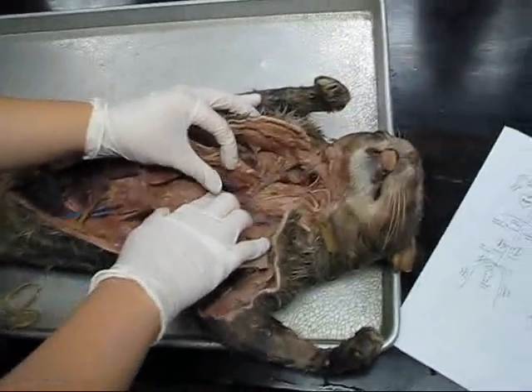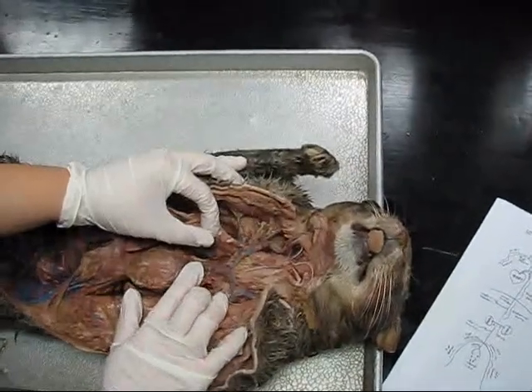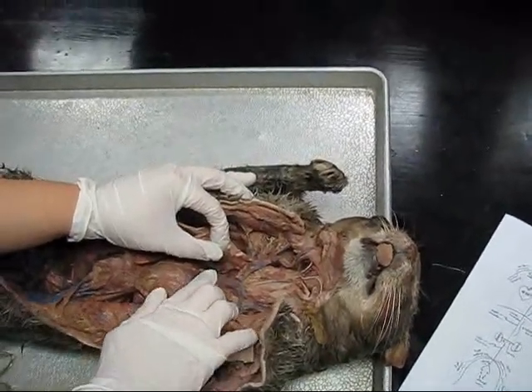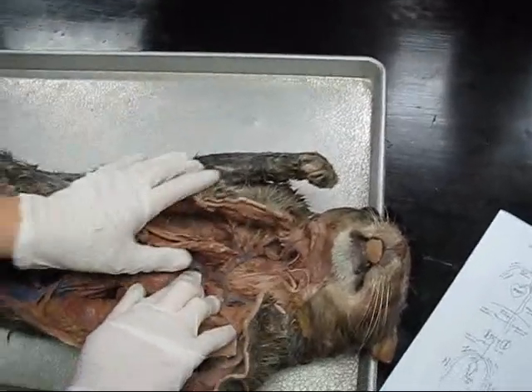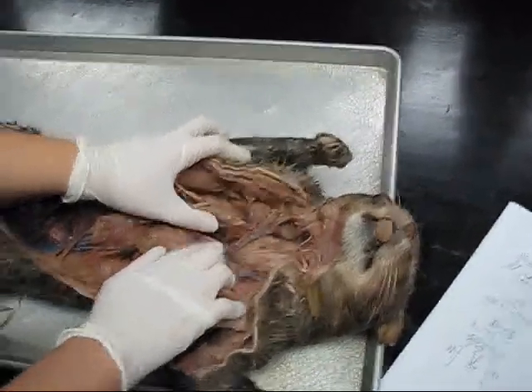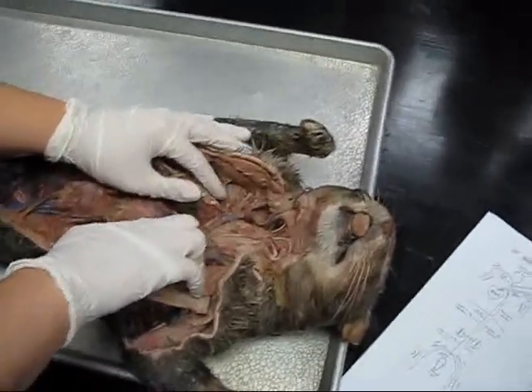What is the first big vein that comes out of the top of the heart? Remember, this is the one that comes out of the top of your heart — if you see anything above the heart, that's the superior vena cava. So that's our superior vena cava right here.